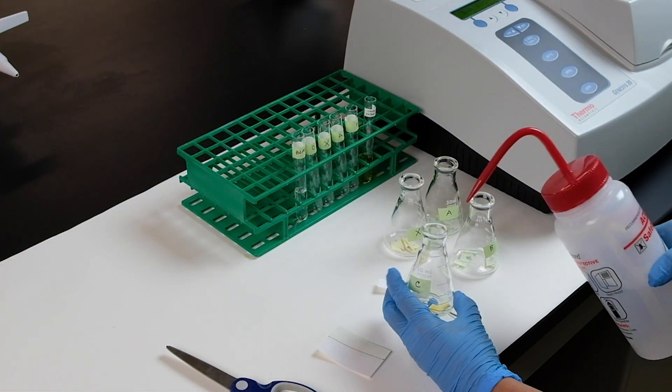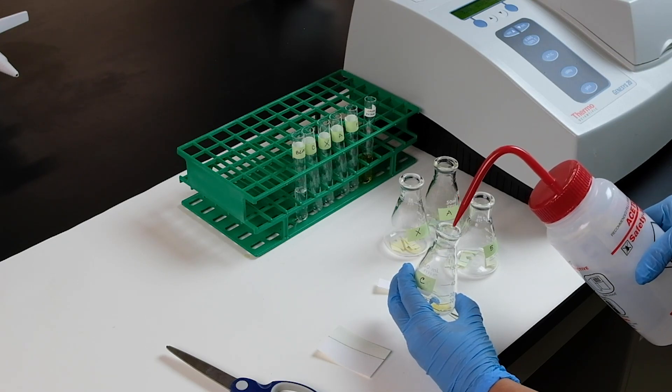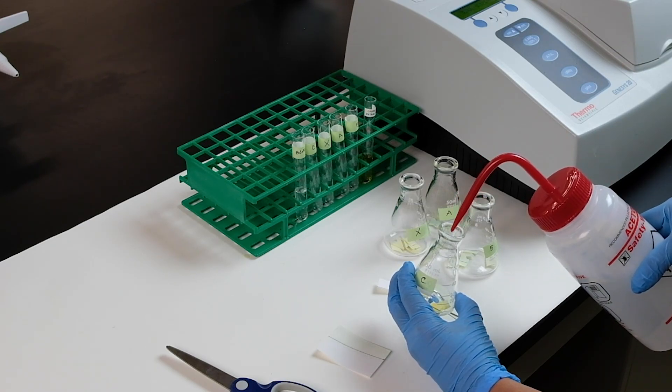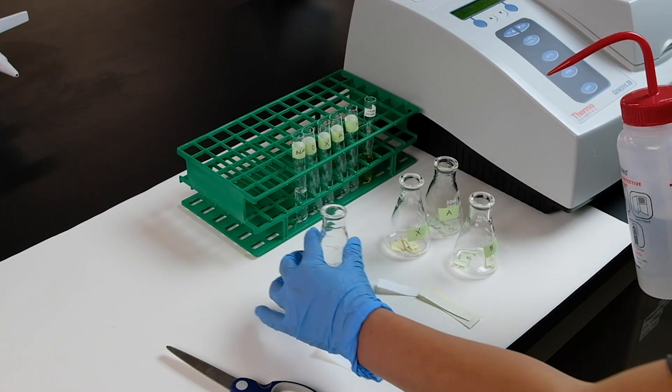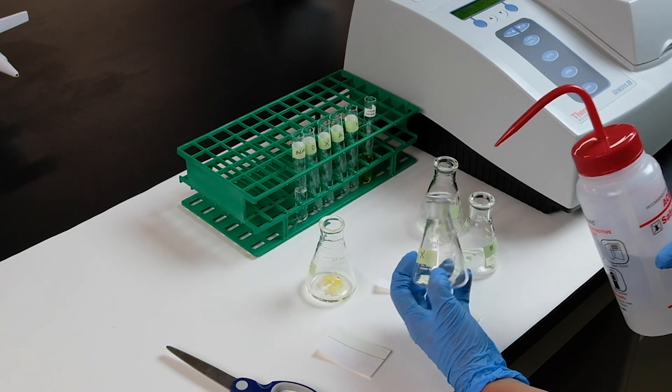Add a little bit of acetone into each tube to extract the pigment back into solution.